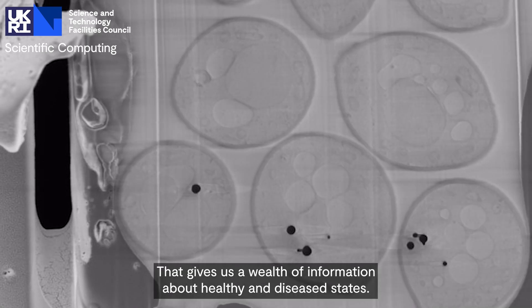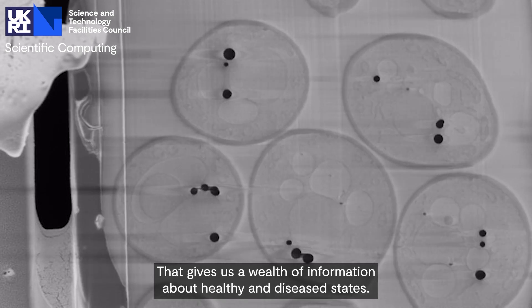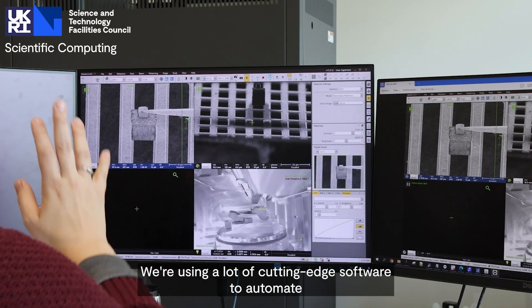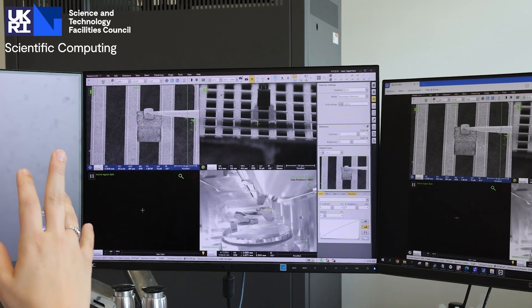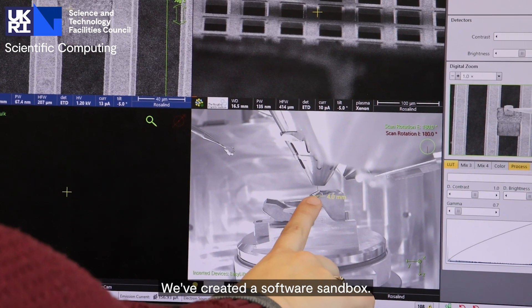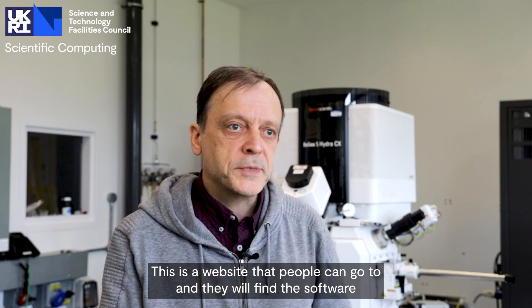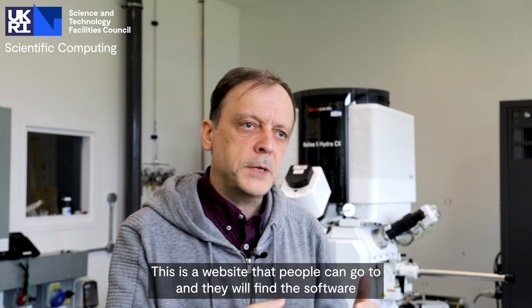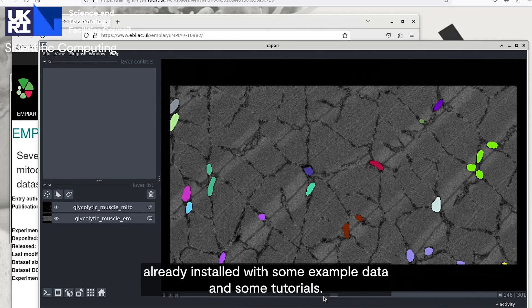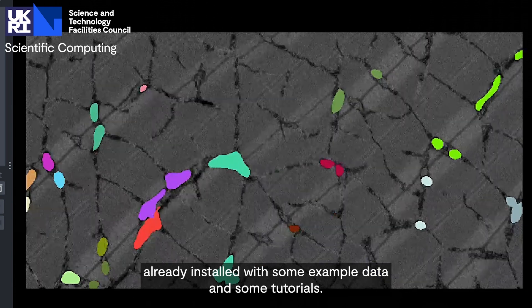That gives us a wealth of information about healthy and diseased states. We're using a lot of cutting-edge software to automate the interpretation of these images. We've created a software sandbox — a website that people can go to, and they will find the software already installed with some example data and some tutorials.